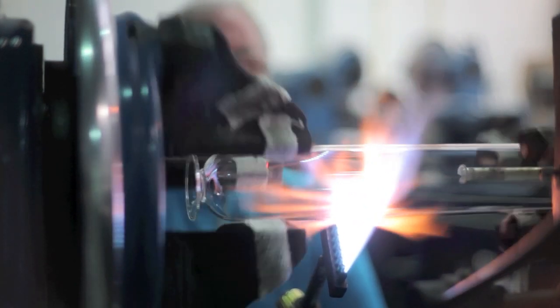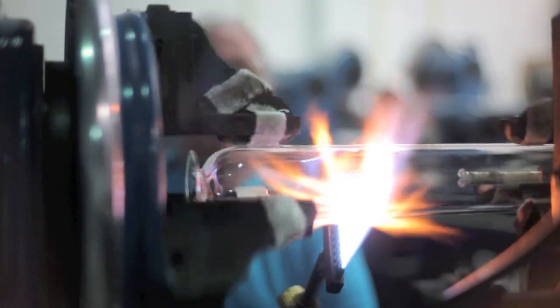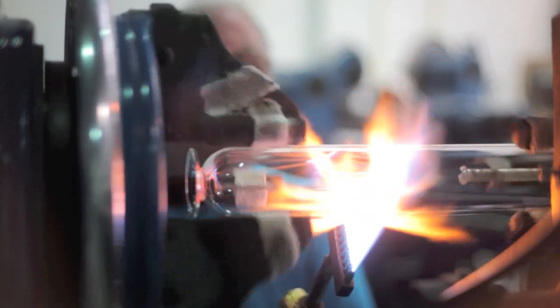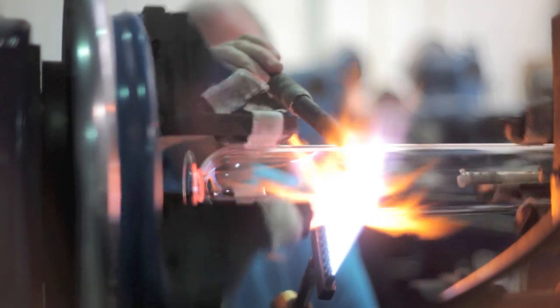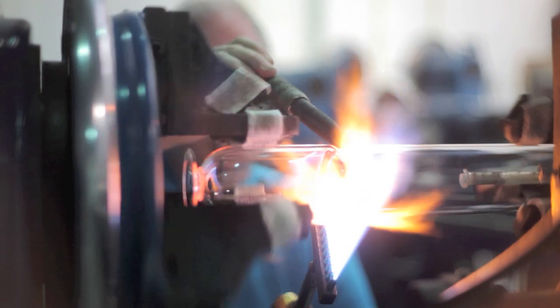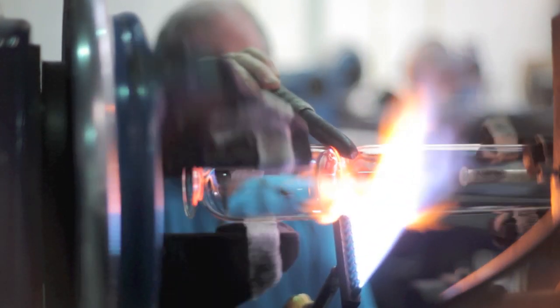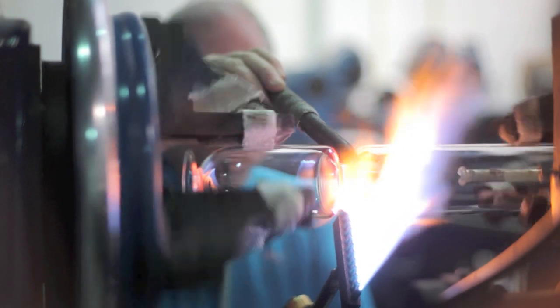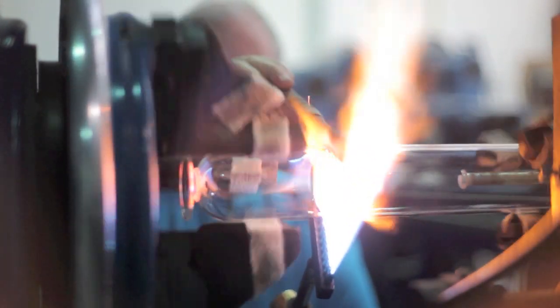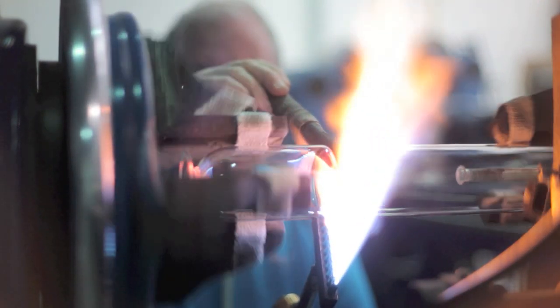The tube you can see coming in there is the other end of the blow tube that I am actually blowing down. Now I am going to use the carbon. Cut it in. I am heating more on one side to give it that curve. It forms part of the bottom of the next beaker. Cut it down so far. I have just got to leave a little hole in there just so I can blow through into the beaker.